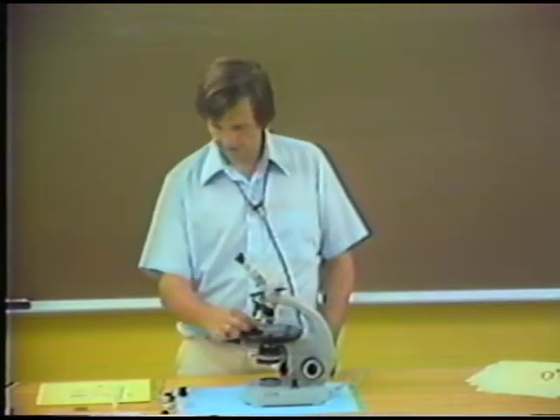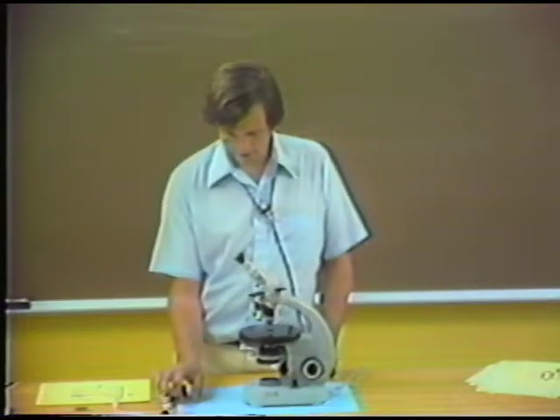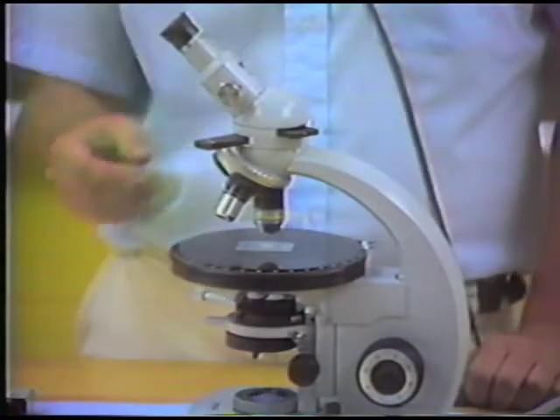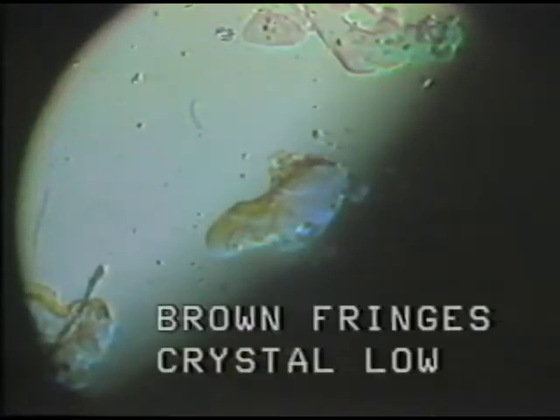Now let's look at the other mount. We'll go to the 1.492 mount and have a look at the color fringes that we see here. Again, I just leave the accessory plate in the slot. We'll look at the colors now on the edge of these mineral grains. And here they are. I think you can see now that the color fringes are brownish in color, distinctly different from the yellow color fringes that we saw before. This means that the refractive index of this particular unknown mineral is just slightly lower than the refractive index of the mounting liquid. And this is a 1.492.